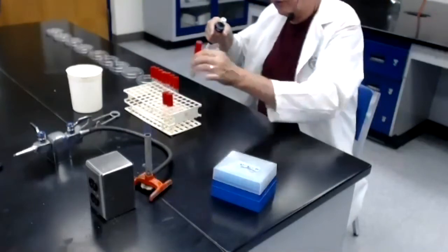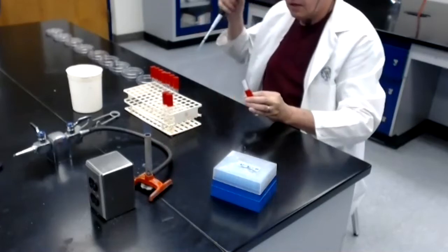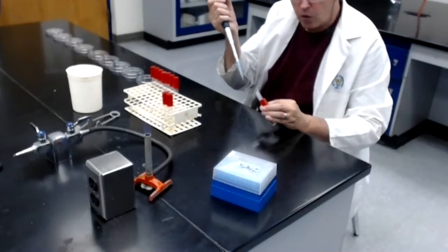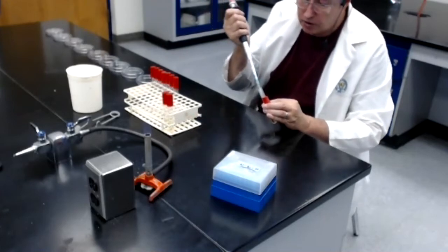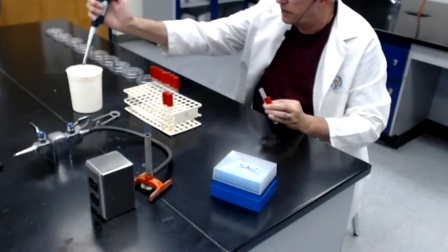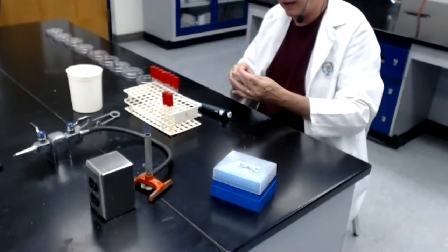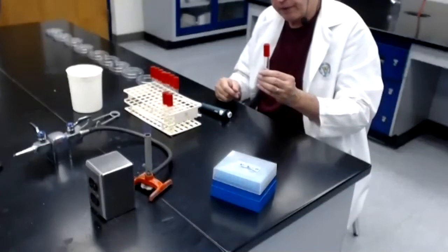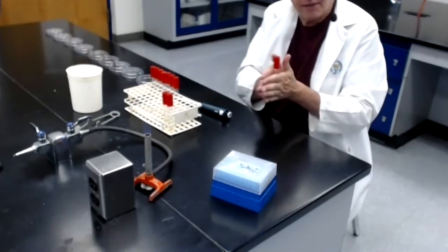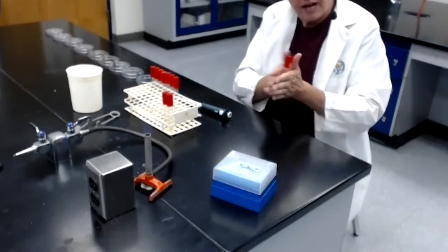Now I grab tube number 3, which contains 9 mils of sterile water. I flame the mouth of the tube. I take the pipette tip, which has 1 mil of the 100th dilution. I am going to transfer that 1 mil into tube number 3. When I'm done, dispose of the tip, flame the mouth, put the cap back on, and now I have just prepared the 3rd dilution, tube number 3, which is labeled a 1,000th dilution. I make sure that I mix this thoroughly.